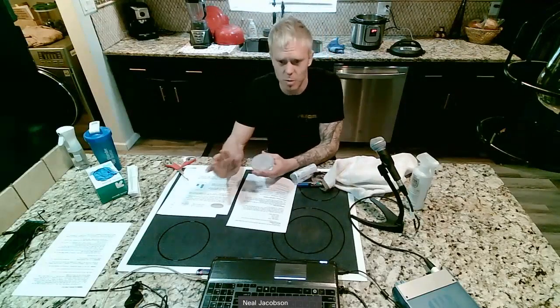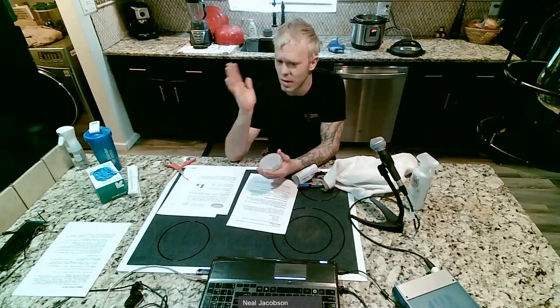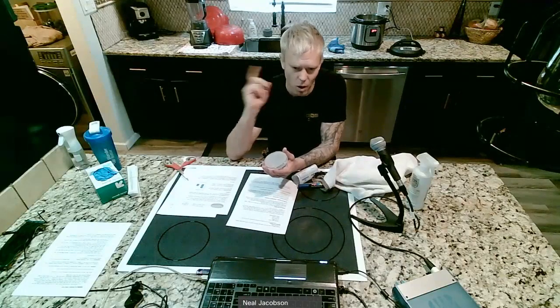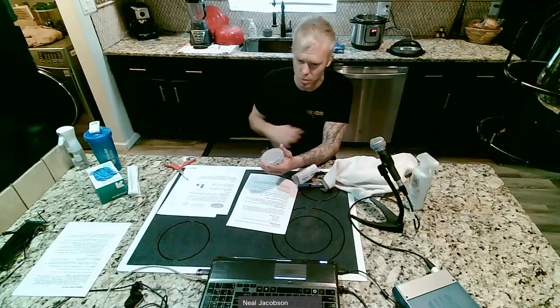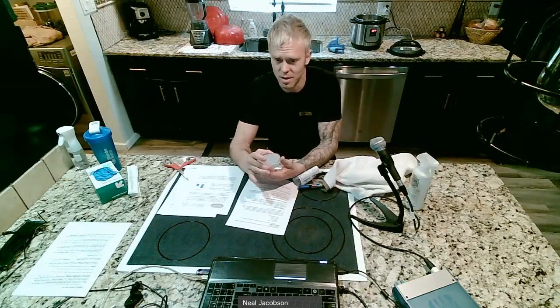Now here's the tricky part. When you open this plate, just remember that you're exposing this plate to dust and mold spores and everything in your environment. Consider this. If you have ceiling fans going, if you have a central air going, if you have anything that's stirring up air around you, turn it off and wait like 10 minutes because that'll allow the dust to settle a little bit. It'll allow the spores to settle so there won't be as much risk of contamination.